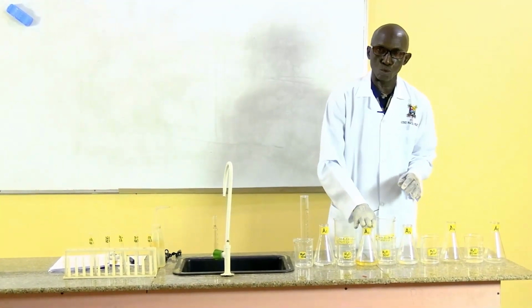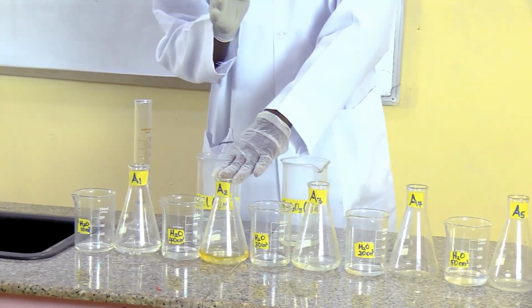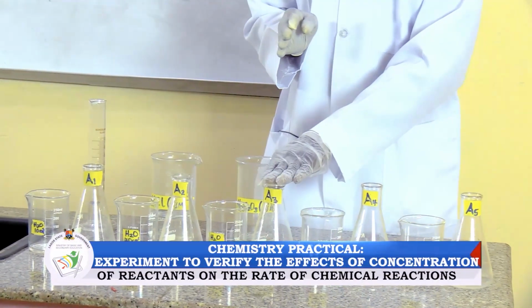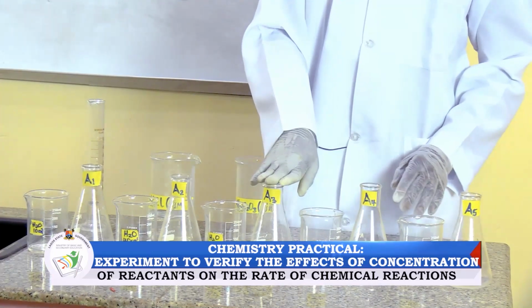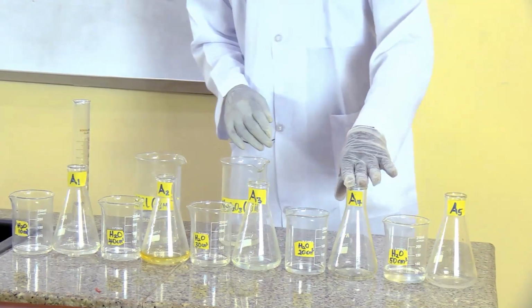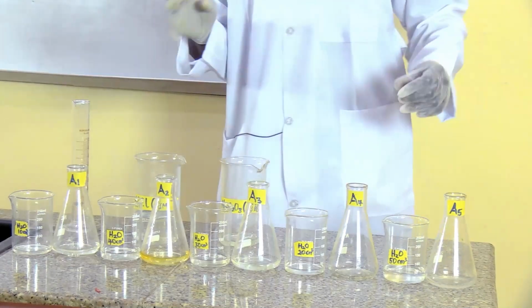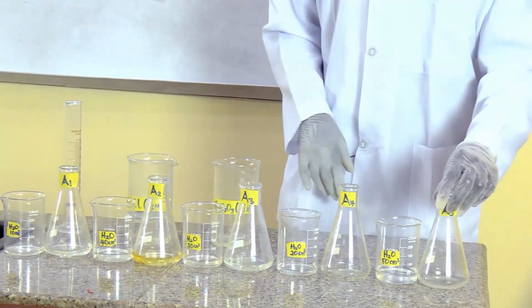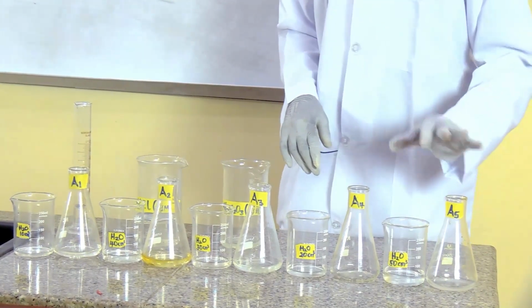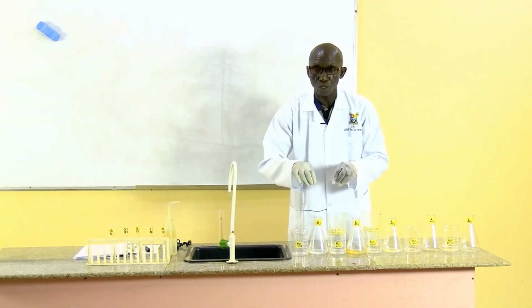In conical flask A2, I have 40 cubic cm of that same solution, that same reactant. The conical flask A3 contains 30 cubic cm of that same reactant. Conical number 4 contains 20 cubic cm of that reactant, while conical number 5 contains just 10 cubic cm.